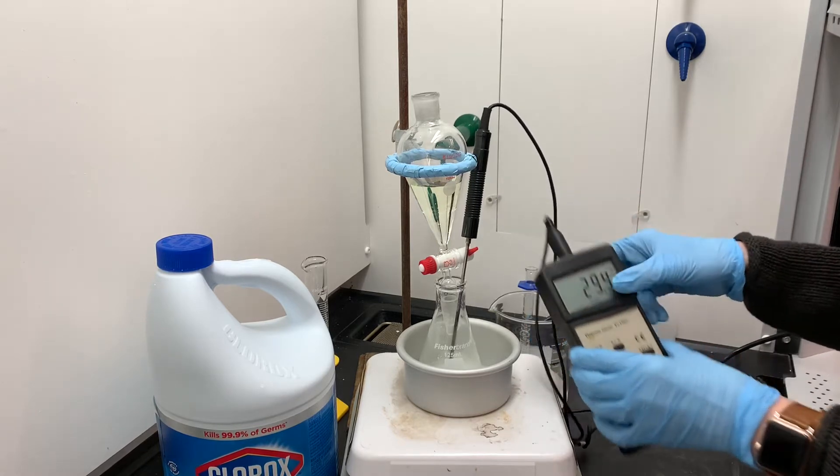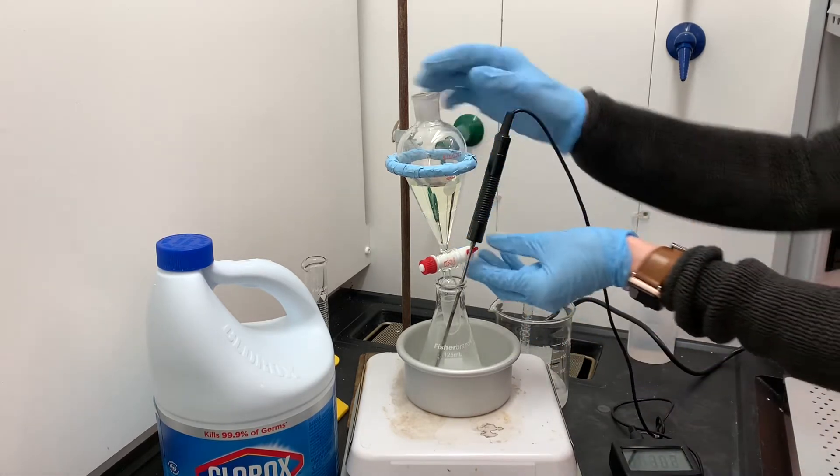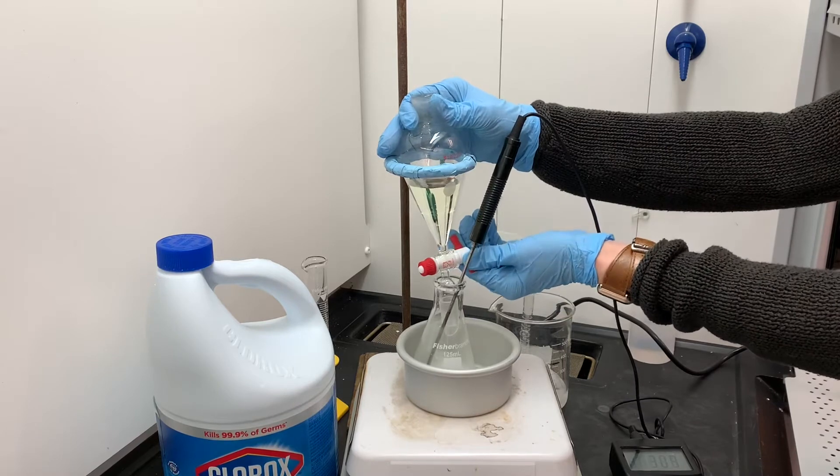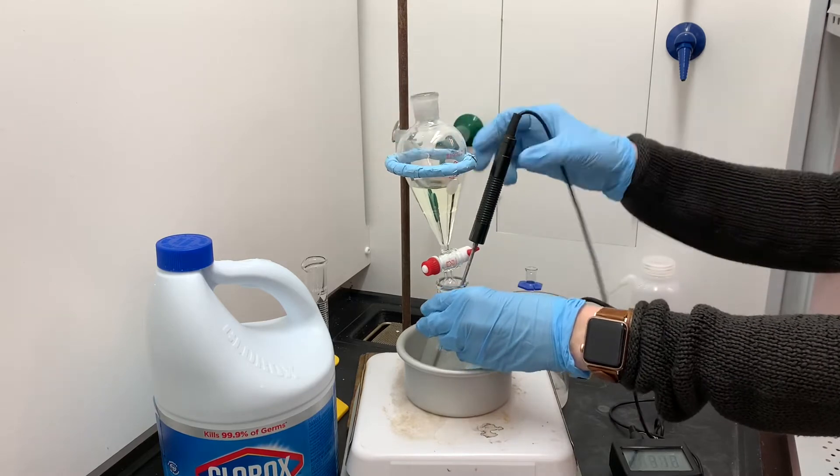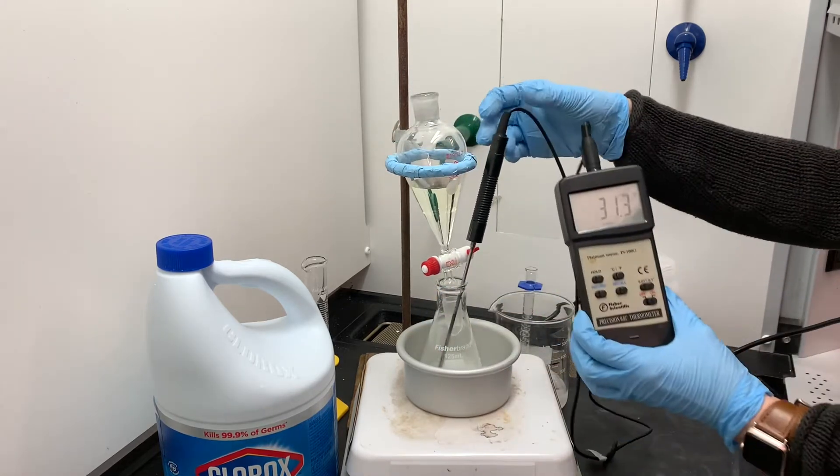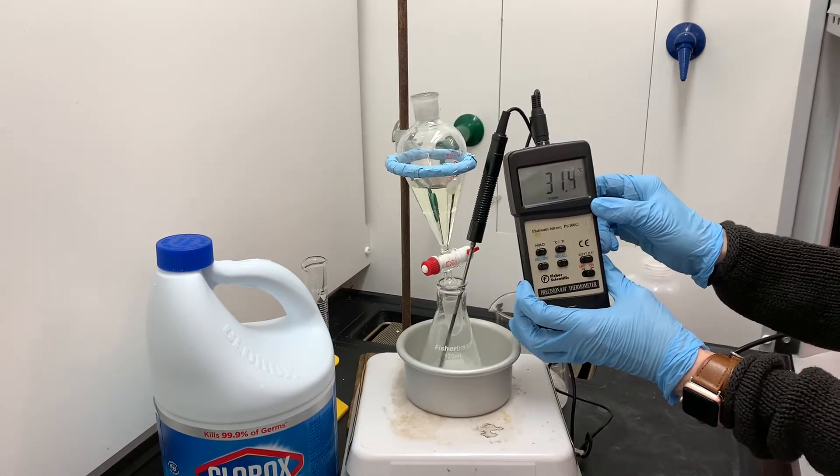So you can see that just with that small addition of bleach, the temperature jumped up to almost 30 degrees Celsius. We're still quite a ways away from 50, so I'll go ahead and put some more in and we'll just kind of keep monitoring the temperature.